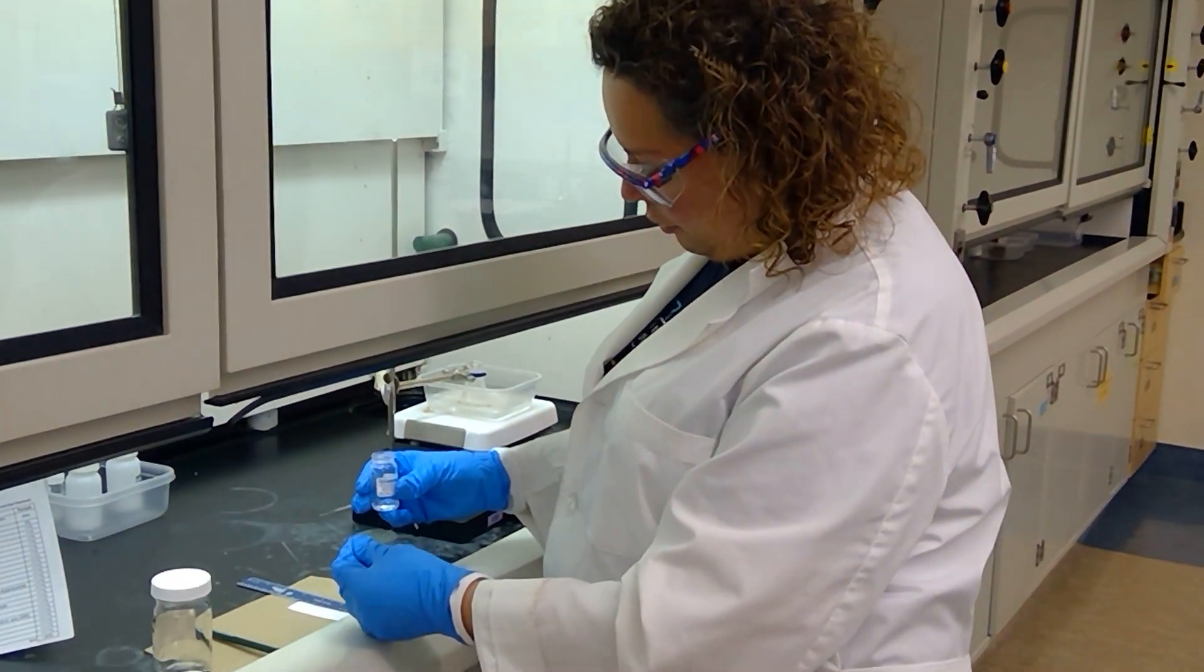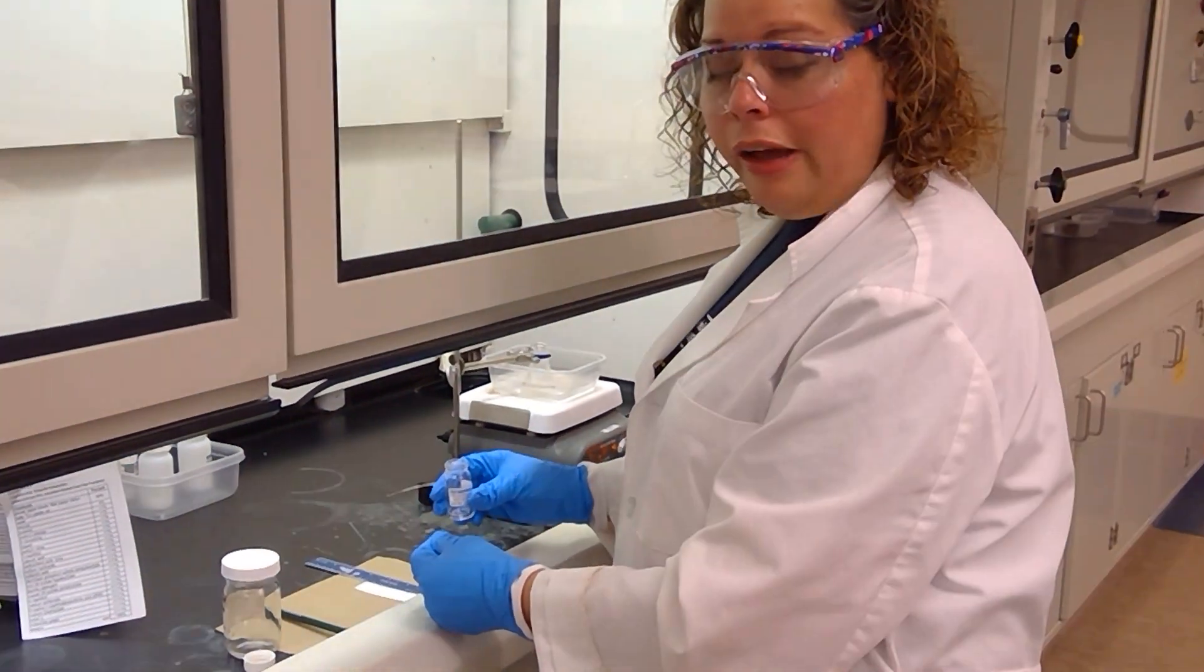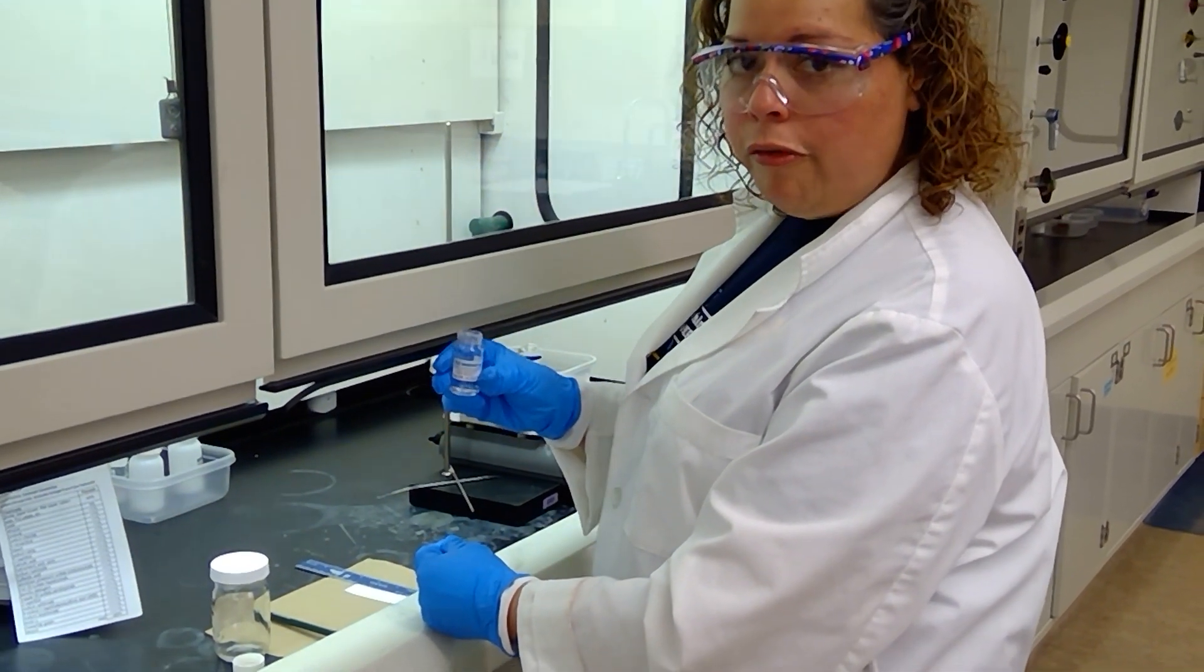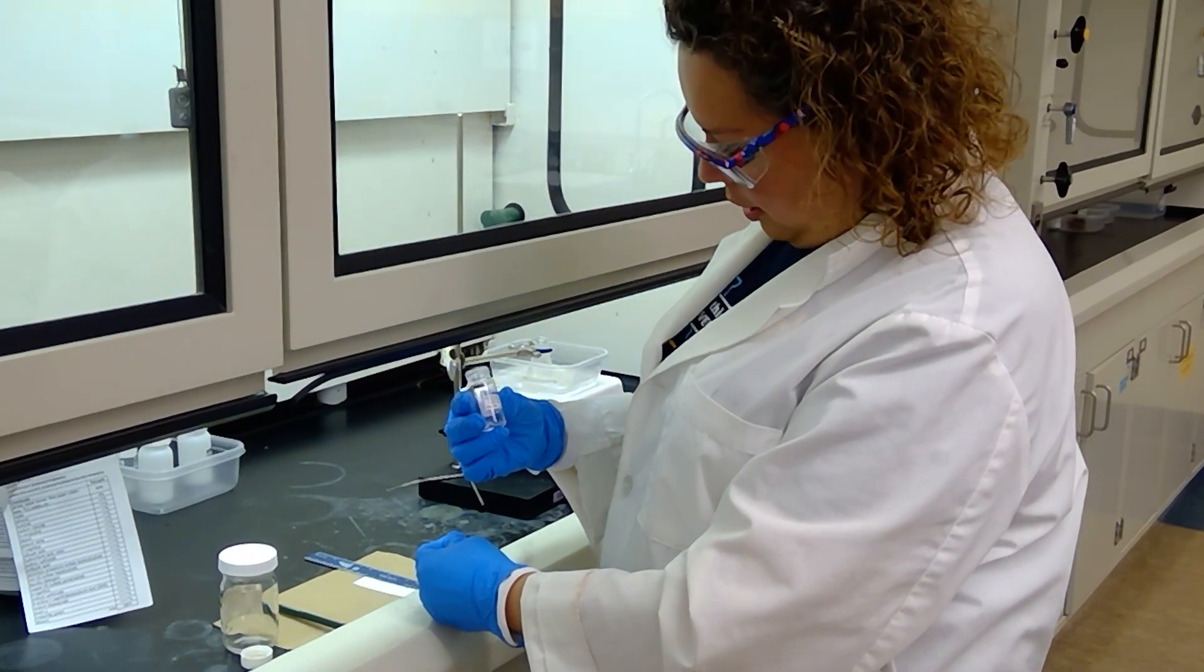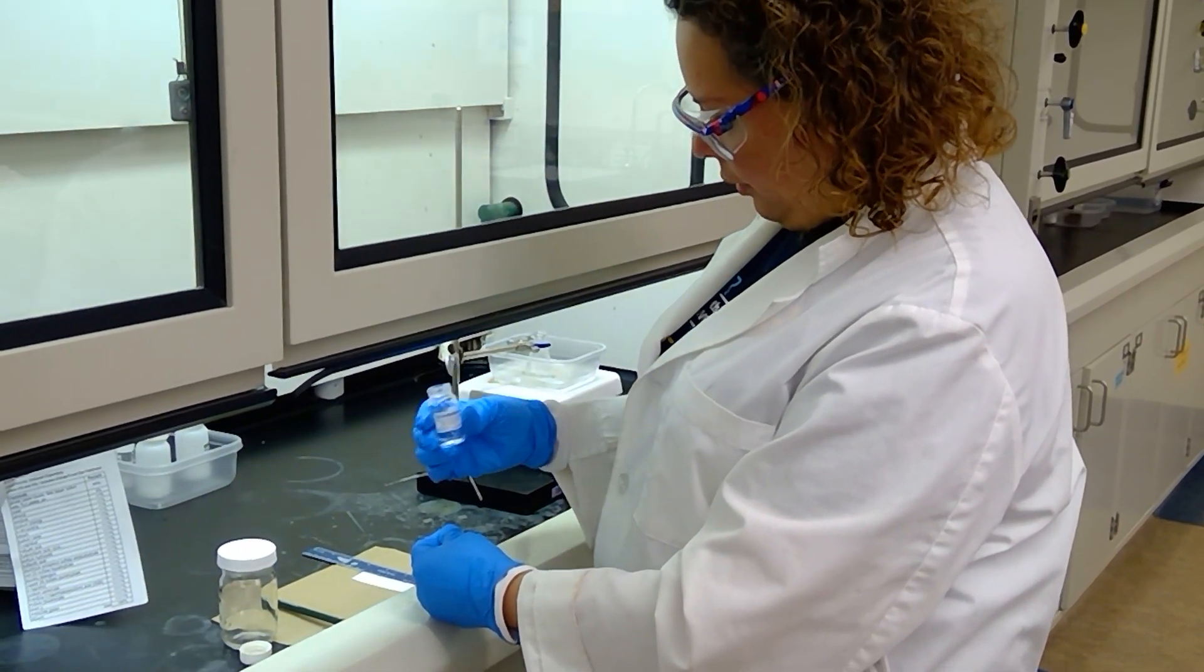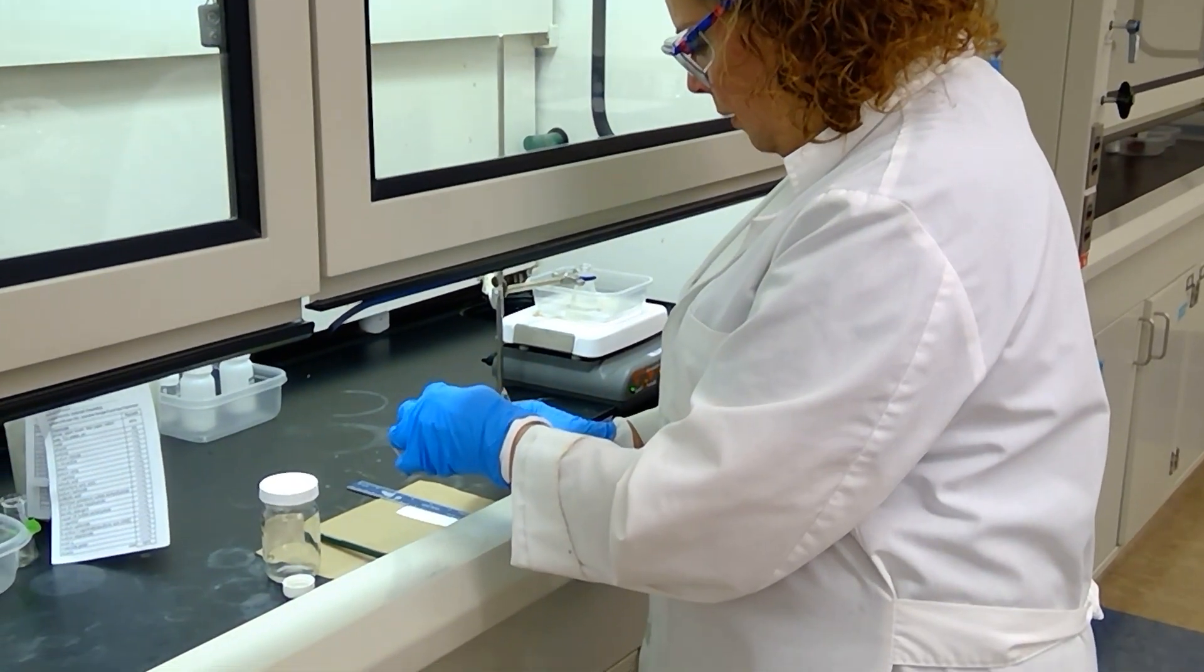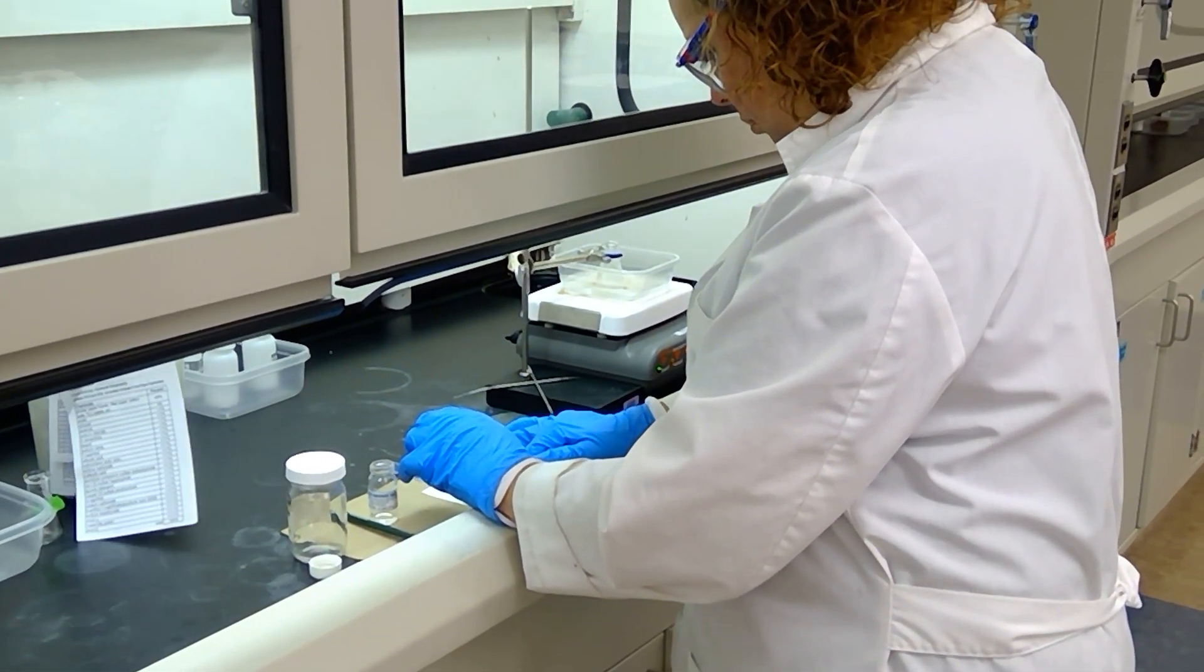Students, we are about to spot a TLC for this experiment to see how the reaction has progressed. I have a standard solution that has a mixture of both benzhydrol and benzophenone in here and it is dissolved in ethyl acetate. So I'm going to go ahead and add a spot of this to my TLC plate. And then I will also be spotting our reaction mixture.